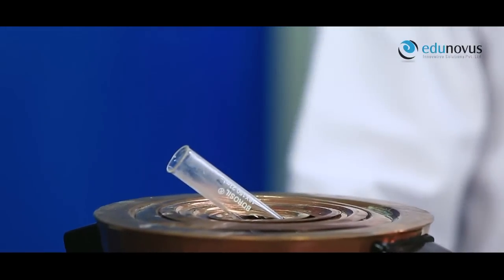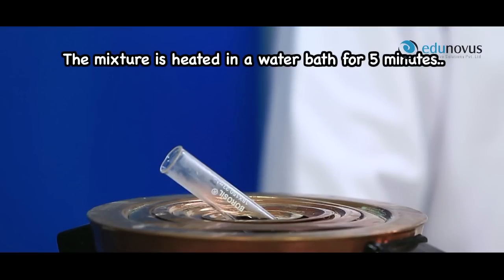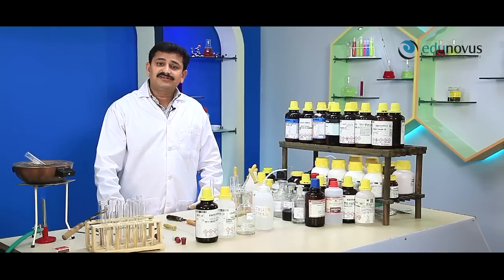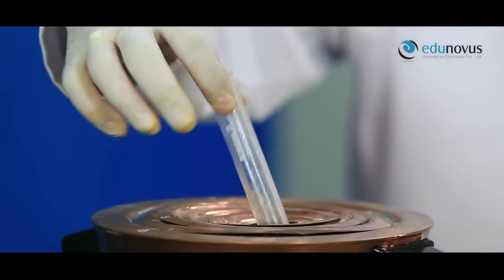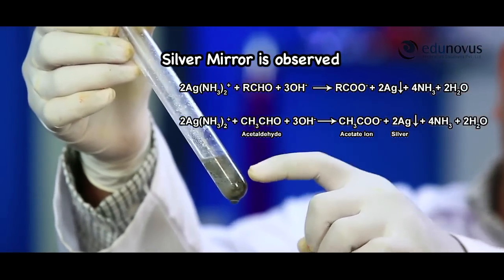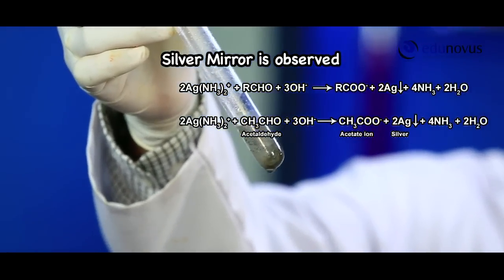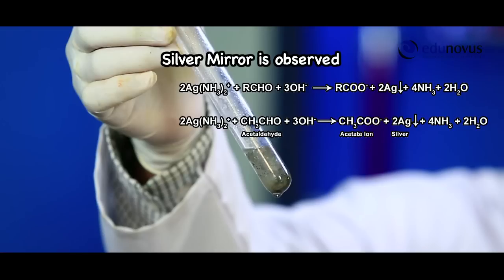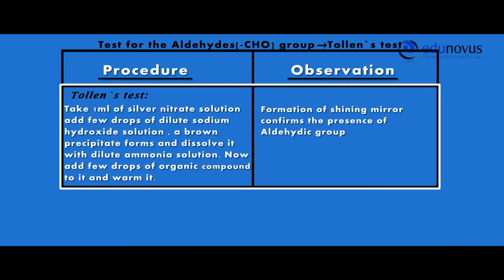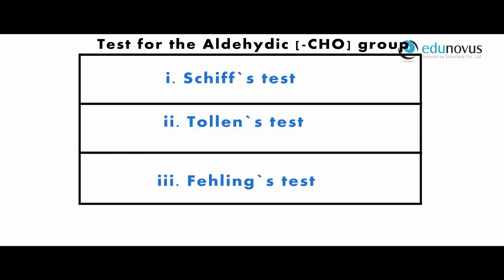Formation of a silver mirror confirms the presence of aldehyde group in the given organic compound. After 5 minutes, here you can clearly see the formation of a silver mirror. This silver mirror confirms the presence of the aldehyde group.